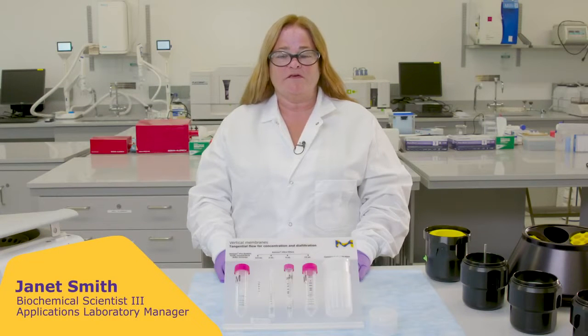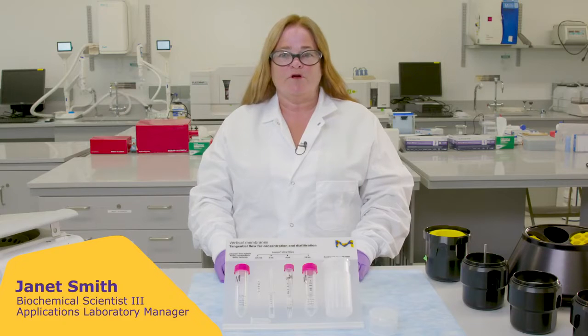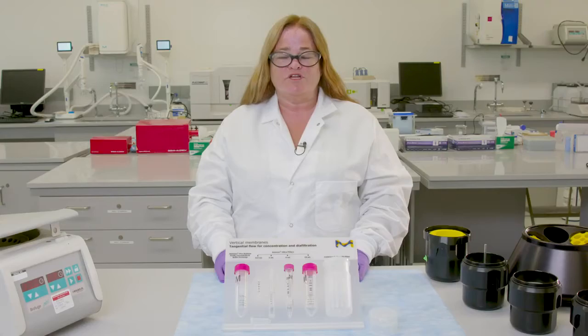Hi, my name is Janet Smith. Today I'm going to be showing you the Amicon Ultra centrifugal filters and the proper rotors for each device.